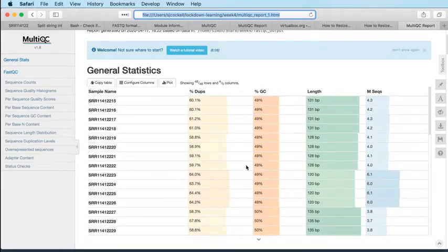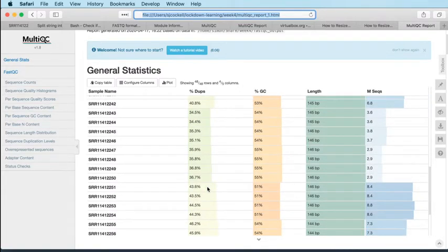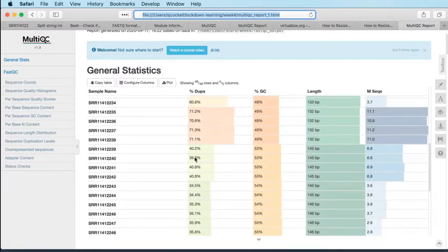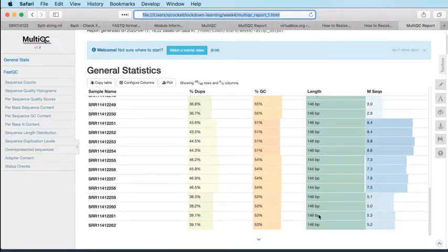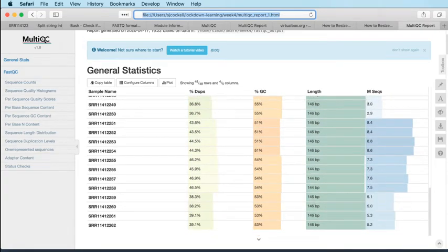So I think those first ones are one batch, and then here's the other batch. I think potentially this is where the status of viral infection changes, is this second batch, where you see that the duplication rate jumps down a bit for this second batch, and again kind of keeps tabs with the coverage. So the more reads you've got, the higher the duplication level, but there's a fairly direct relationship between those two things. So again, no real cause for concern there.